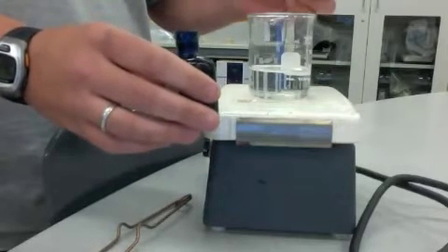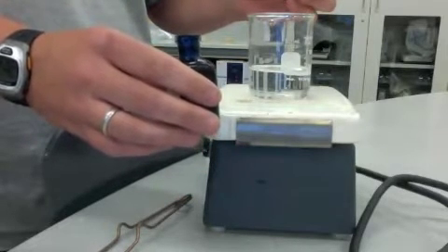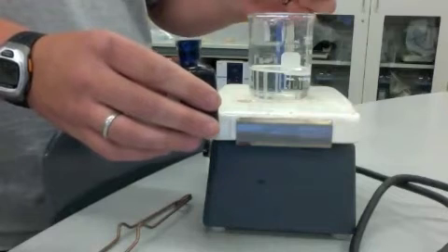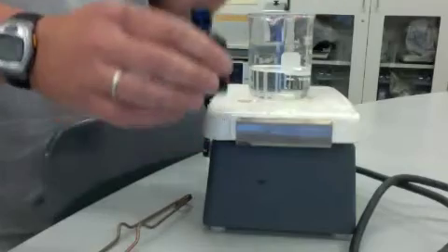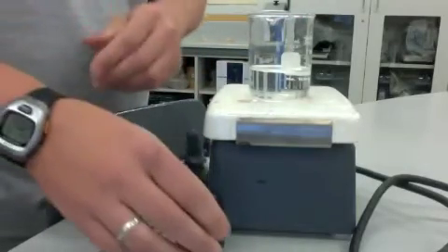The important thing is to watch this every couple of minutes. Go back and look at this. This has got to stay wet. If this dries out, the thing won't work. You do this and baby it for about five minutes.